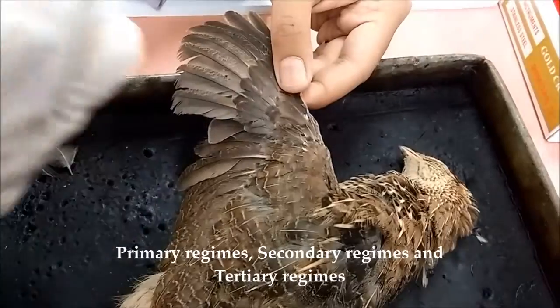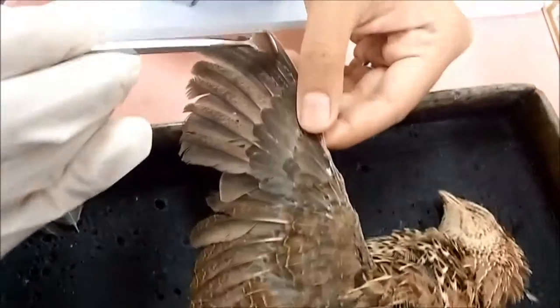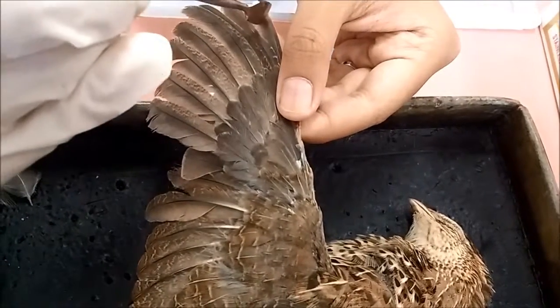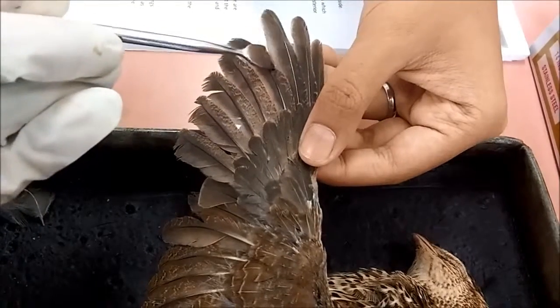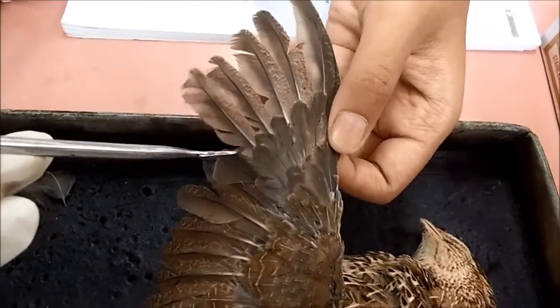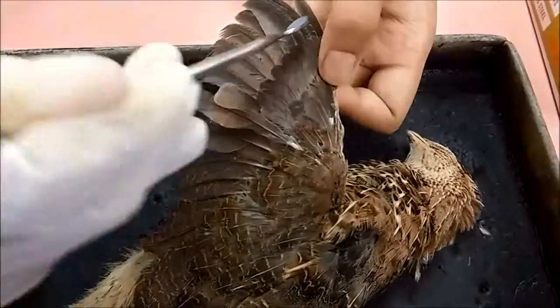We have to identify which is the primary, secondary, and tertiary. For the primary, we count 10. So this is first, second, 3, 4, 5, 6, 7, 8, 9, 10. This is the primary remiges.